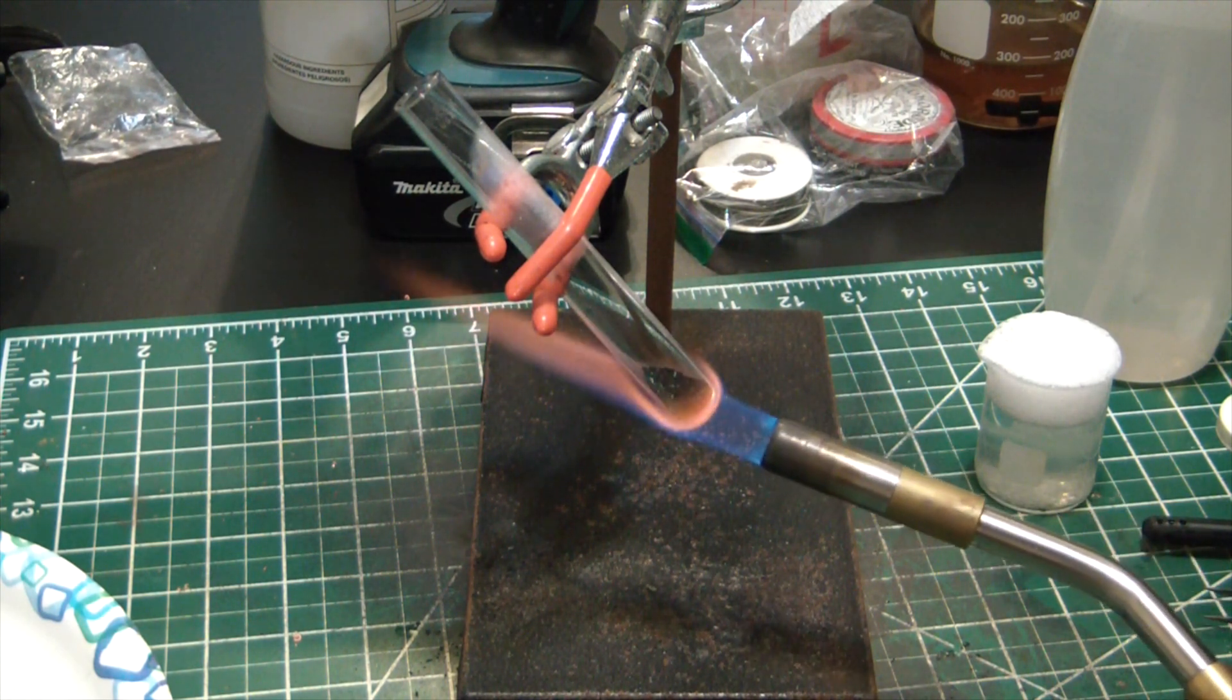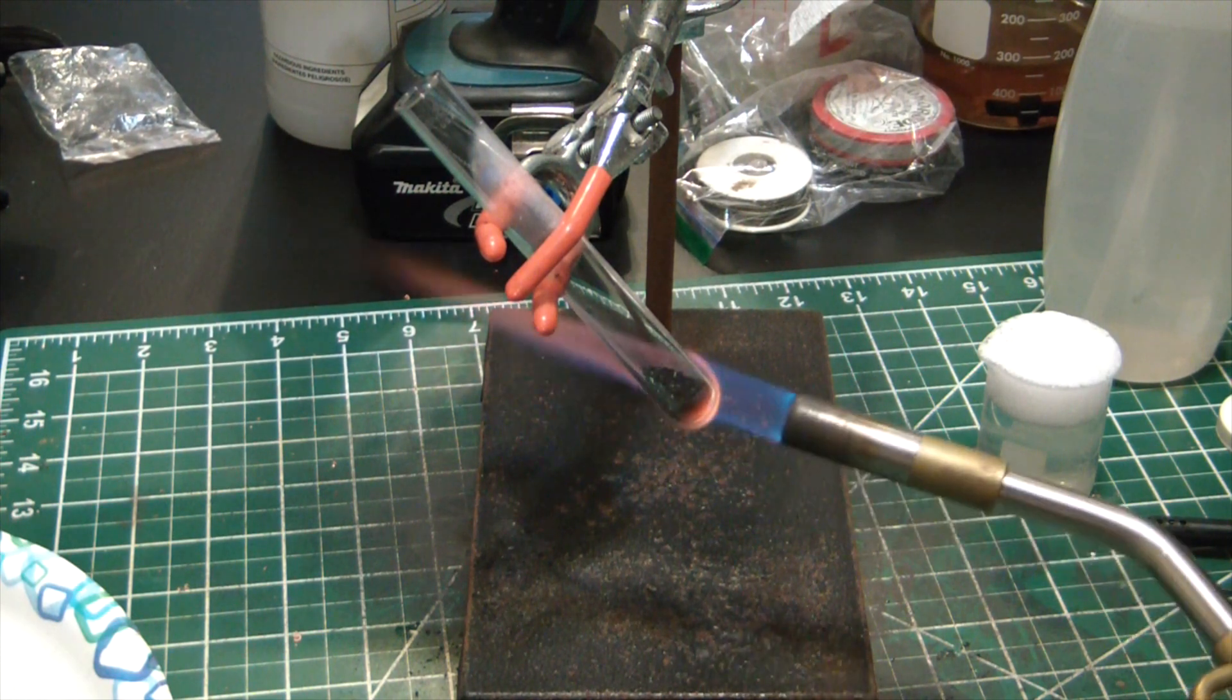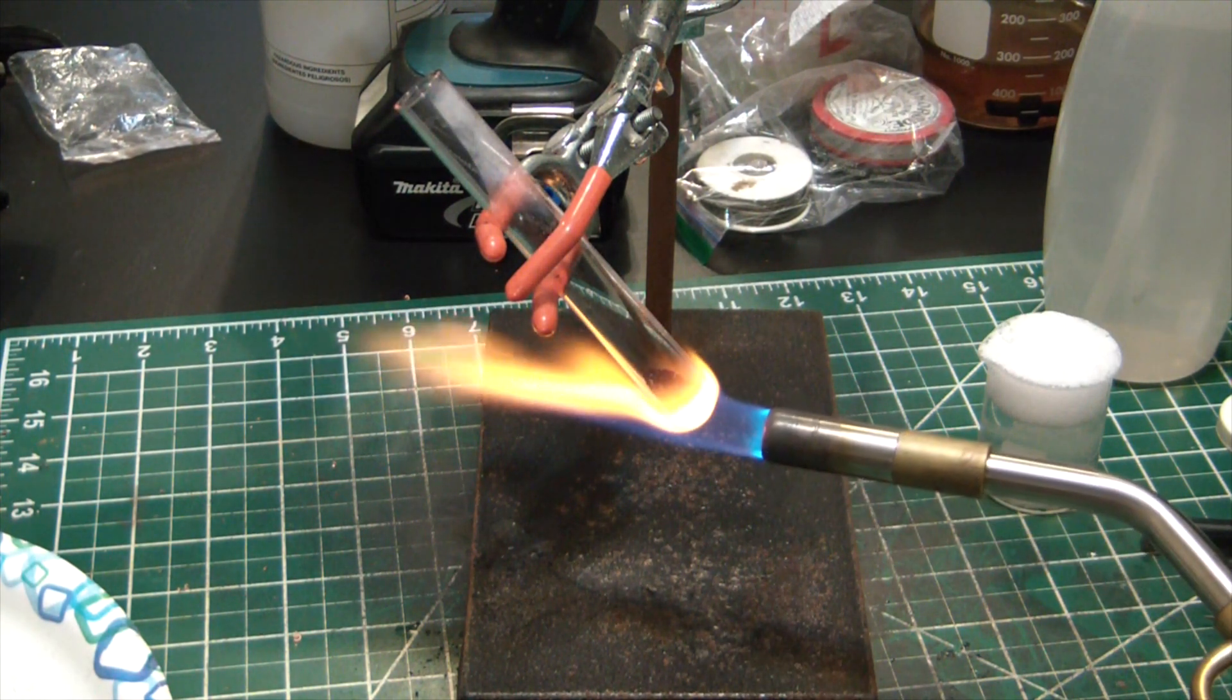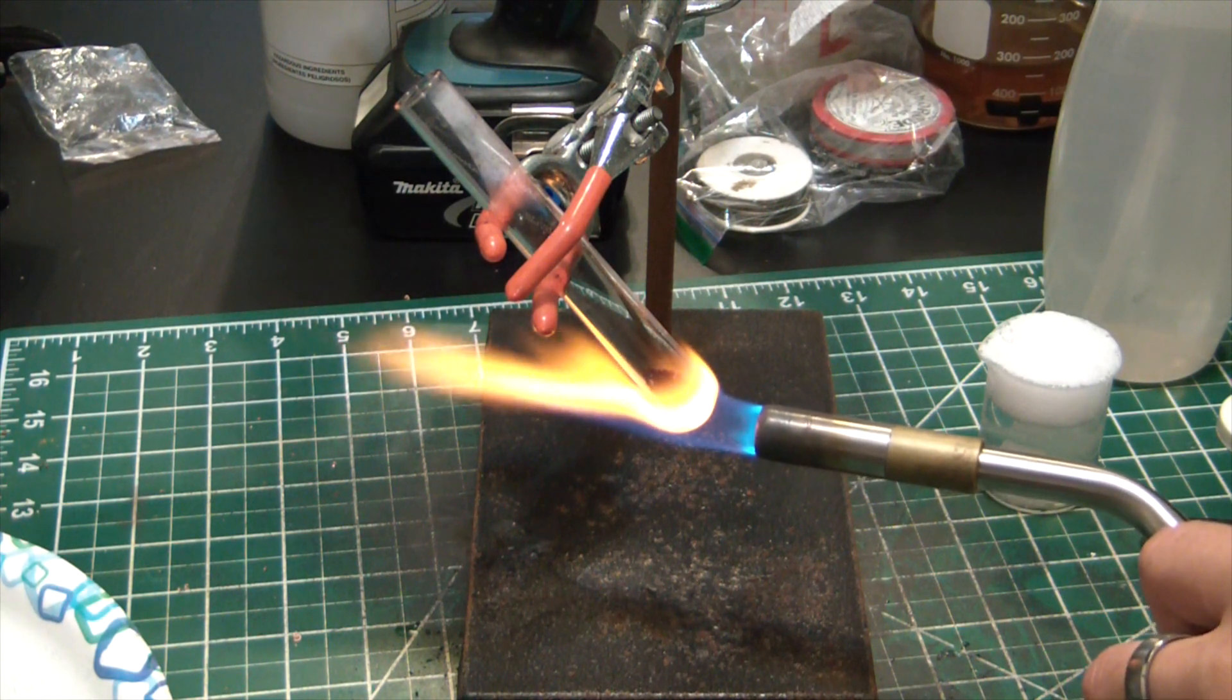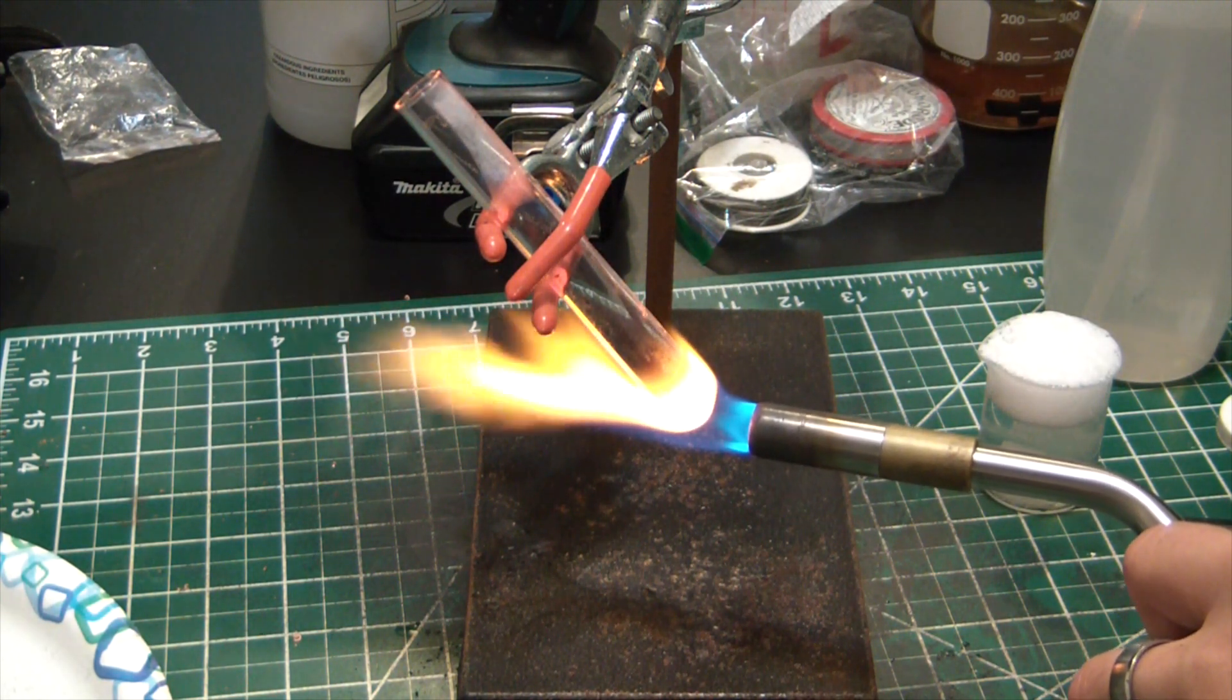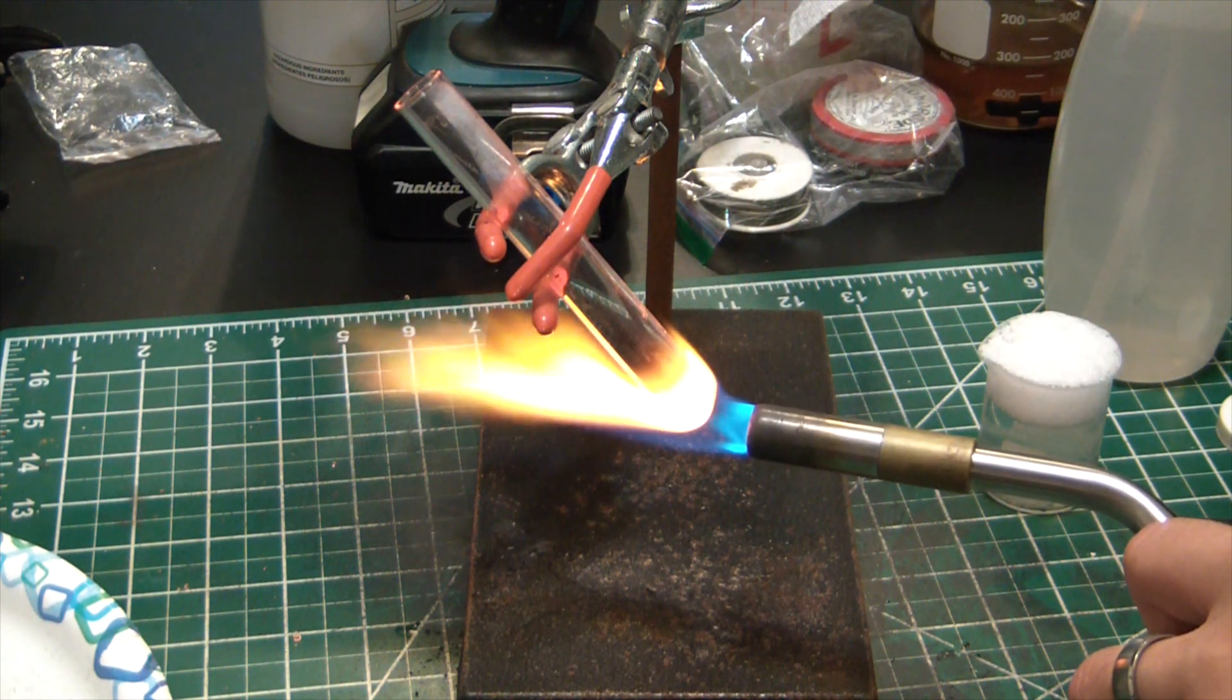Rather than solid chunks, just seeing as more surface area gives better reactivity. There we go, we got a reaction.